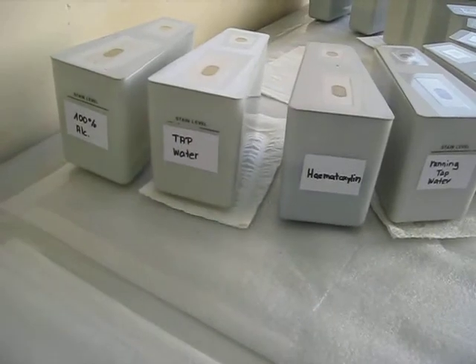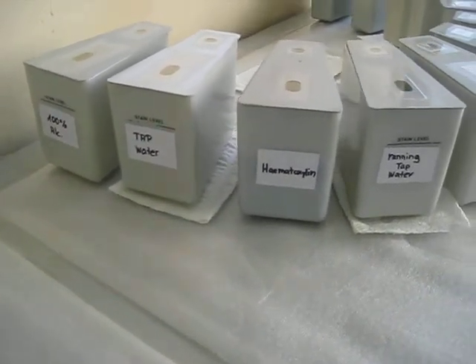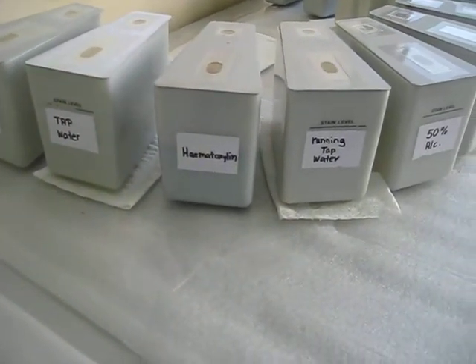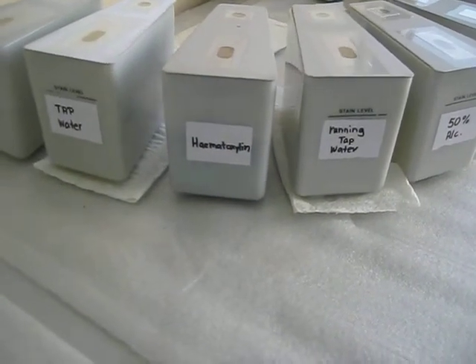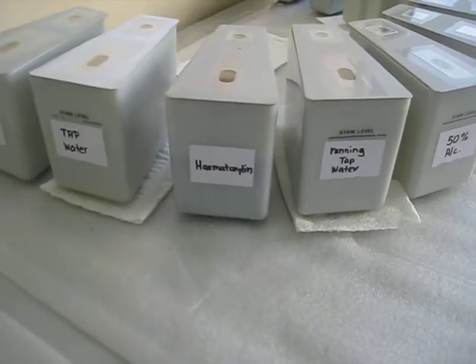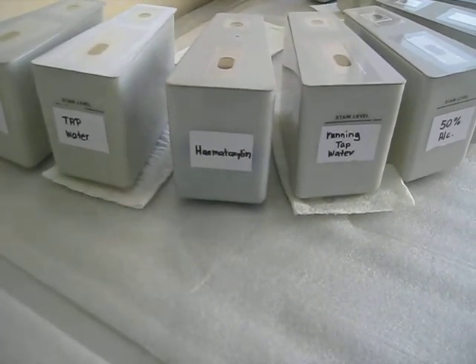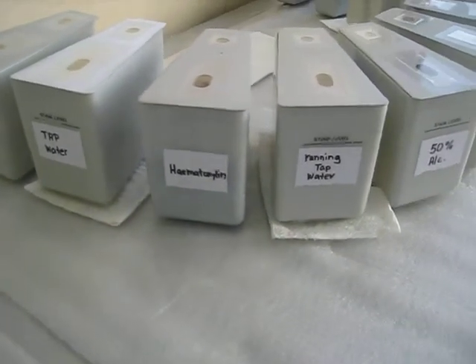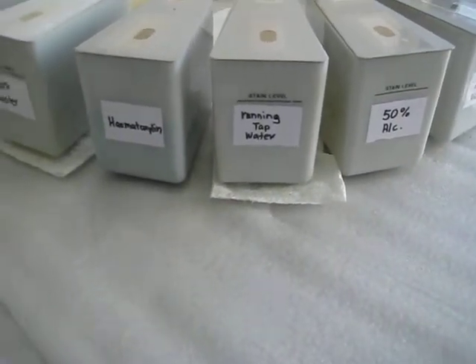You move the specimen to tap water first because hematoxylin is a water-based stain, so you put it in regular tap water before going to hematoxylin. Hematoxylin is a nuclear stain, so you have to ensure the nucleus is well stained — usually 1.5 minutes is enough, though it may need longer depending on how fresh the hematoxylin is.